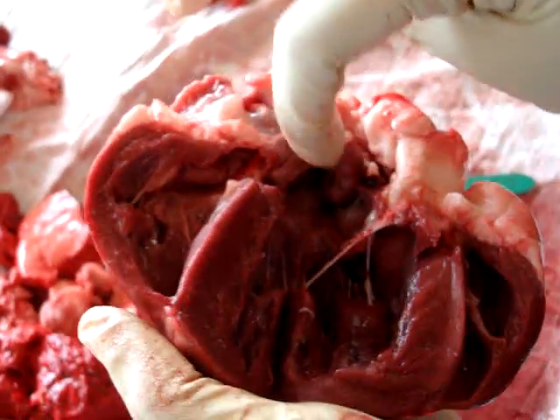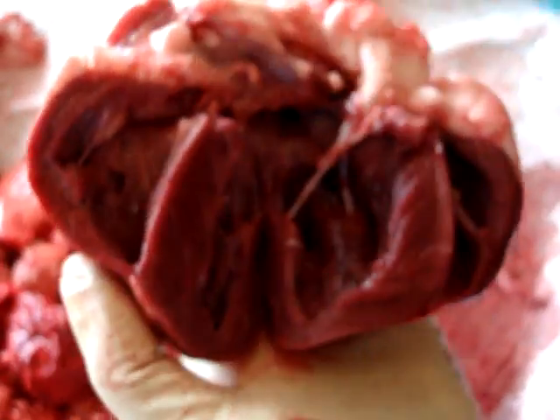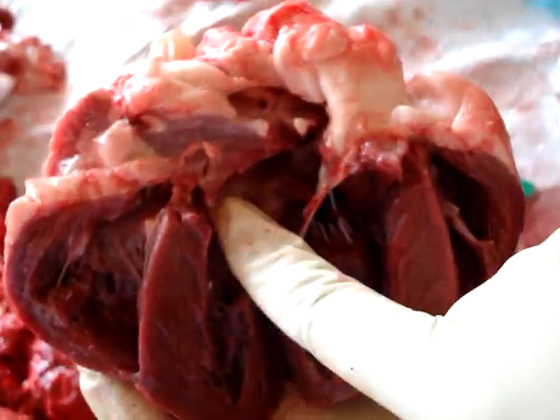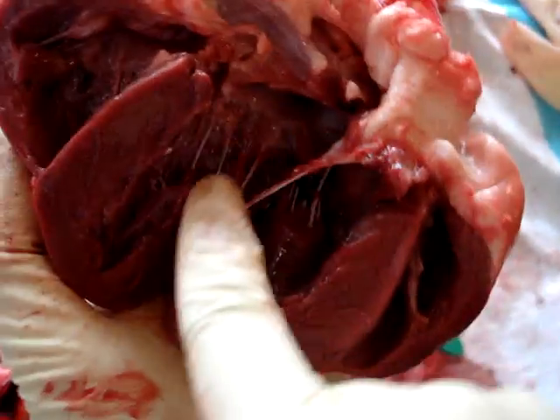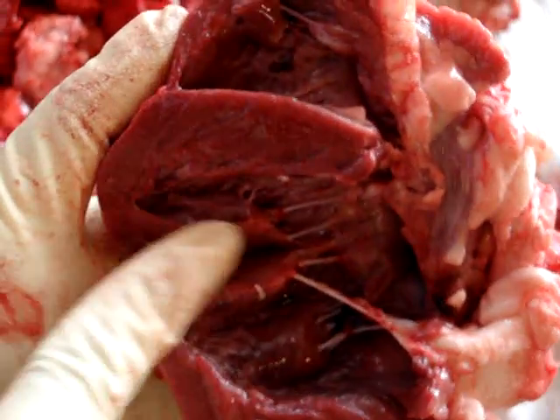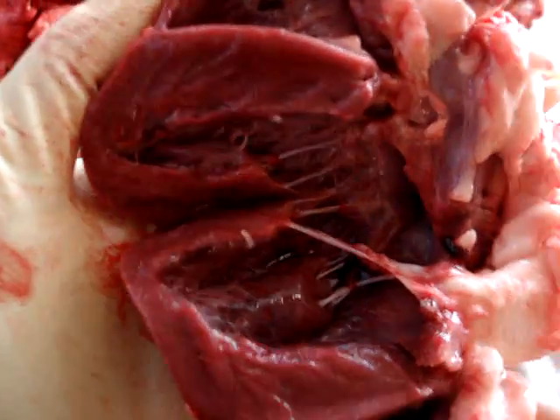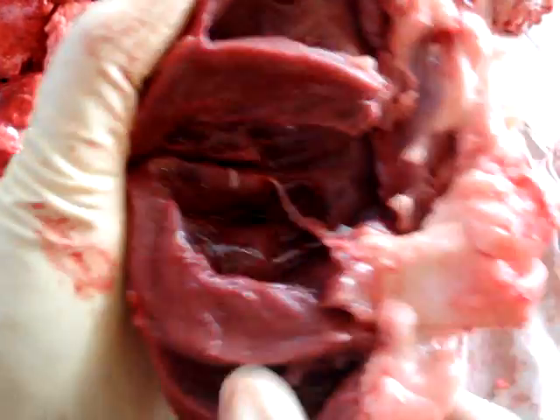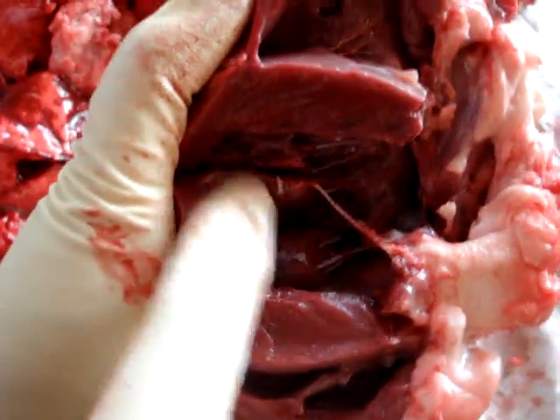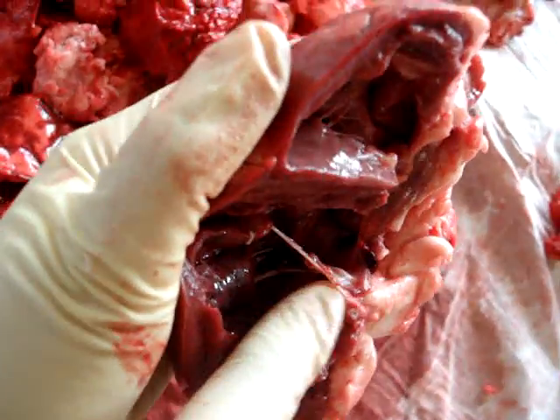This is your left atrium, and then it goes down to your bicuspid valve. Here you can see where it's thicker because it's in the left ventricle, and this is actually a part of the left ventricle too, and then it goes up through your aorta.